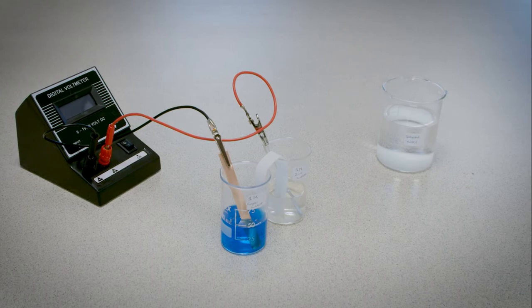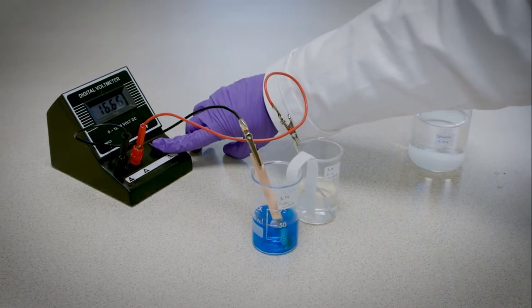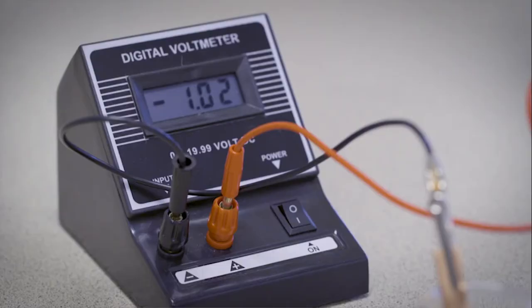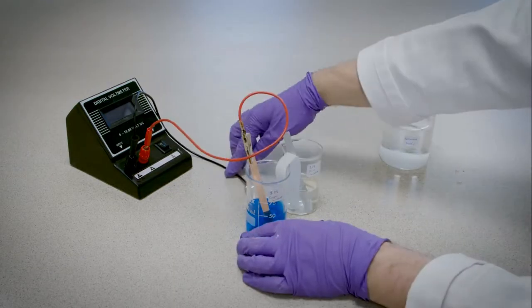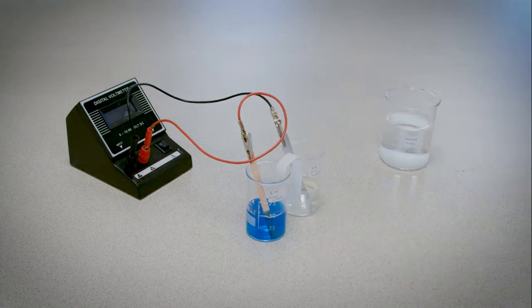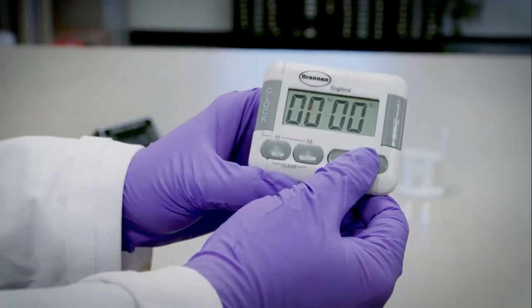in the electrochemical cell. If a negative voltage is produced, the terminals attached to each metal are switched around, so that a positive potential difference is registered and the voltage is recorded. The cell is left working for 20 minutes.